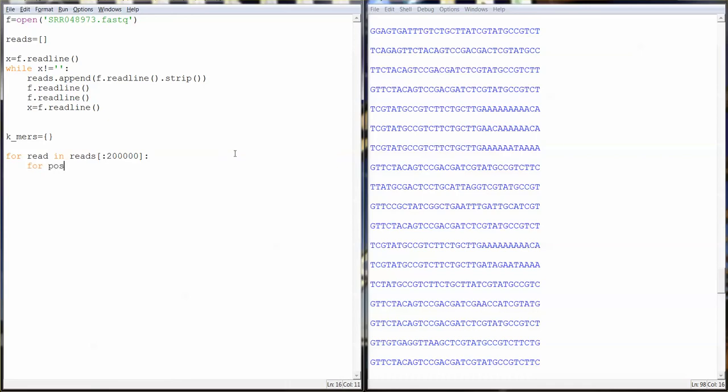And then we're going to take slices of each read because we don't exactly know the length of the k-mer that we're looking for. So we're going to do range 6 to 30. And then we're going to set our dictionary key to be the read up to that position. And we're going to use the get method of dictionaries up to that position, so the same key we just created. If the key does not exist, we're going to return the value of 0, and if it does, we're going to go ahead and add 1 to it.